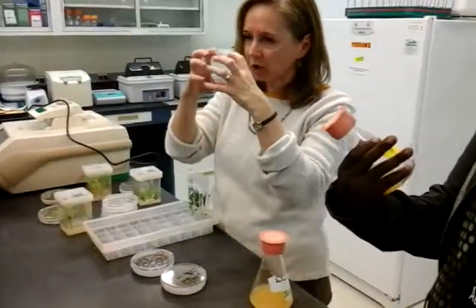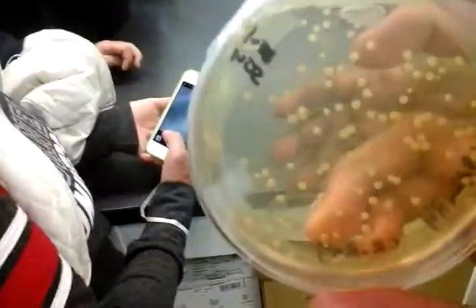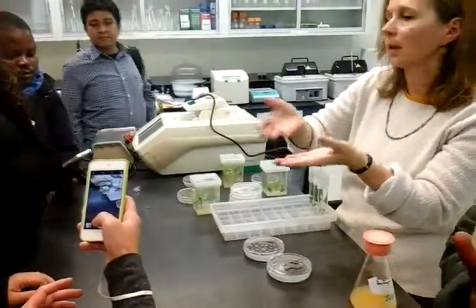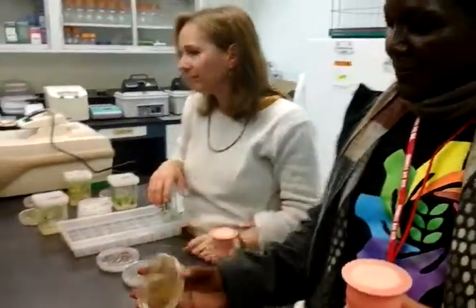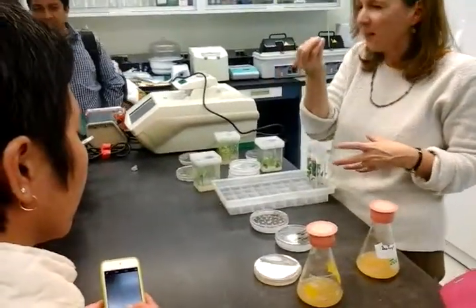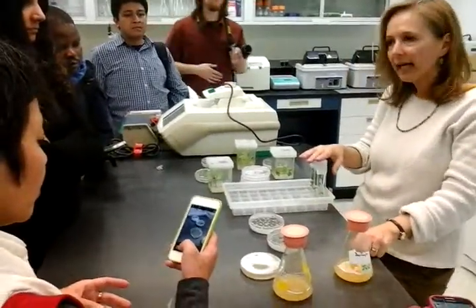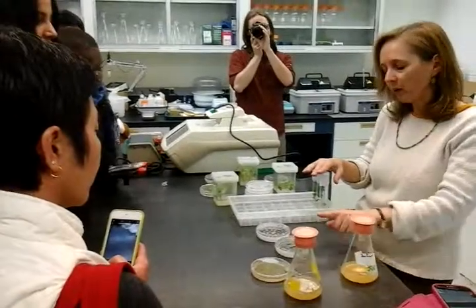When we apply the electrical charge, pores open in the bacteria. That's the agrobacterium — we spin it, put it in a tube, spin it down, get a pellet of bacteria, and re-suspend that in a plant culture medium. This bacterial medium has really high salts, and plant material is very sensitive to high salts, so we have to remove this bacterial culture medium before we put the plant material in there.